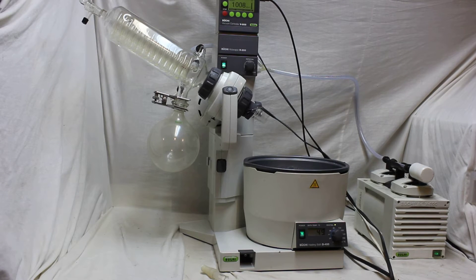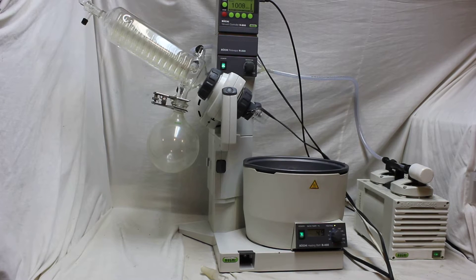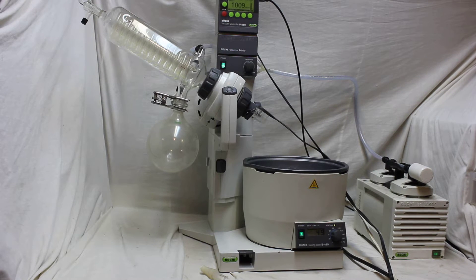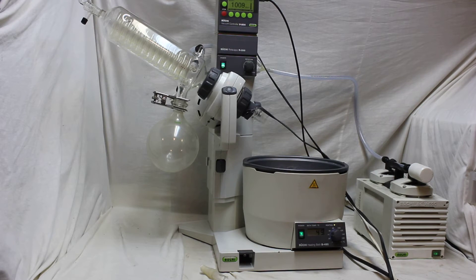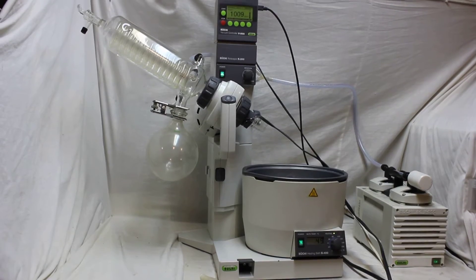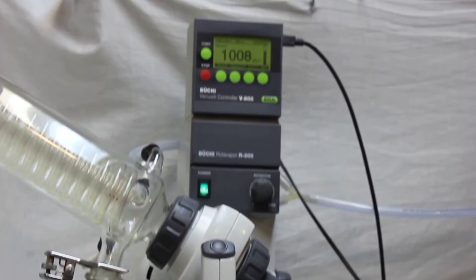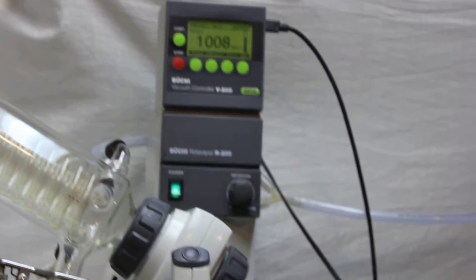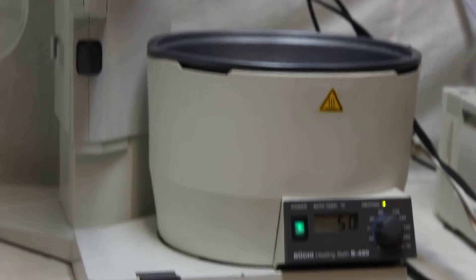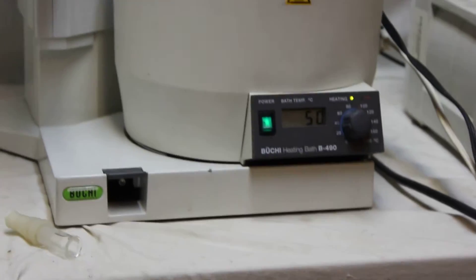Hello everyone, it's Nano Platen again. Now we are testing the Buchi R200 which is equipped with V800 vacuum gauge controller and also B490.